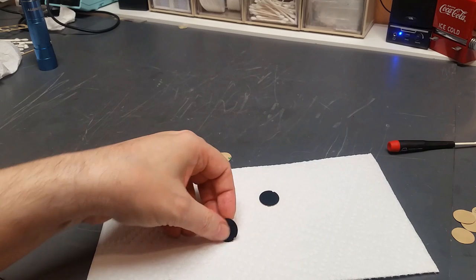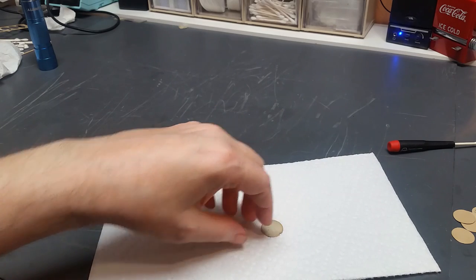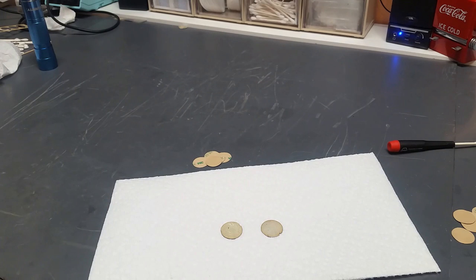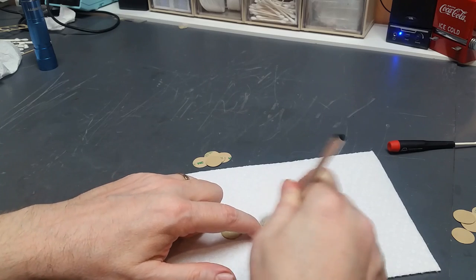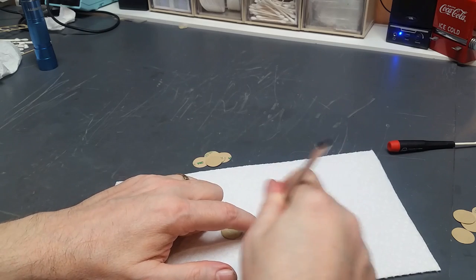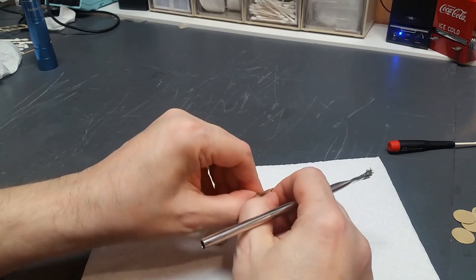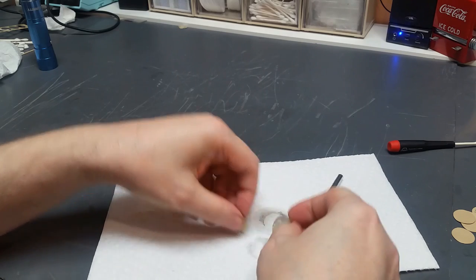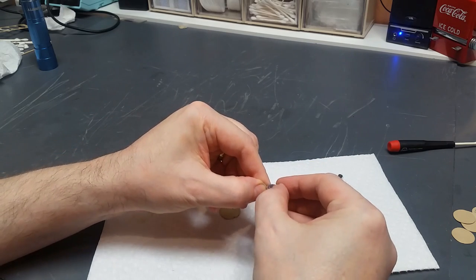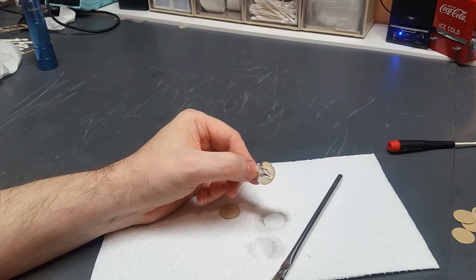Okay, it's time to reinstall these knob caps onto the fine focus knobs so that we can finish up this job. I'm going to start by cleaning off all the old adhesive that was on there because that stuff's dried out over the years and really doesn't hold anything at this point. All it'll do if I leave it on there is interfere with the bonding of the adhesive that I'm going to put on there to replace it. So I'm taking a brush here and some acetone and I'm scrubbing that off. It's starting to come off as you can see. Let's keep it going. So you get the idea. I'll do the rest of this cleanup off camera so you don't have to bear through it.